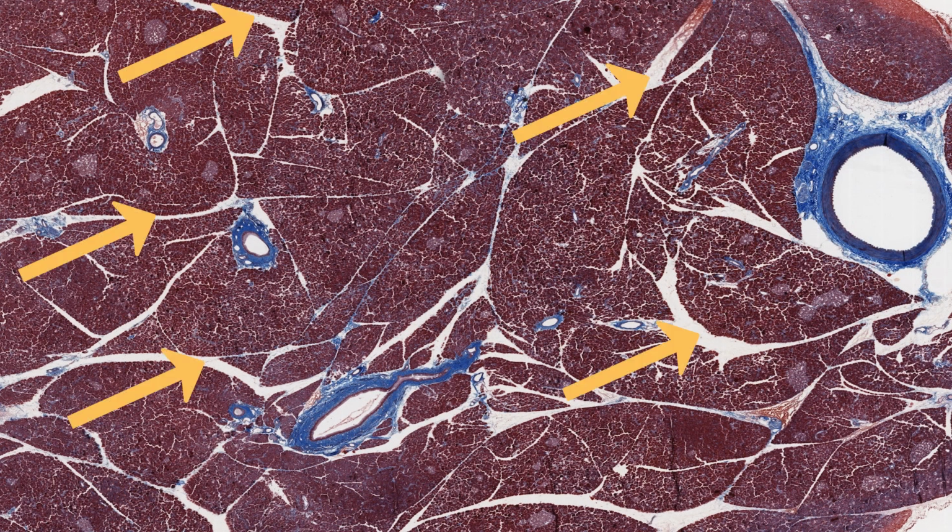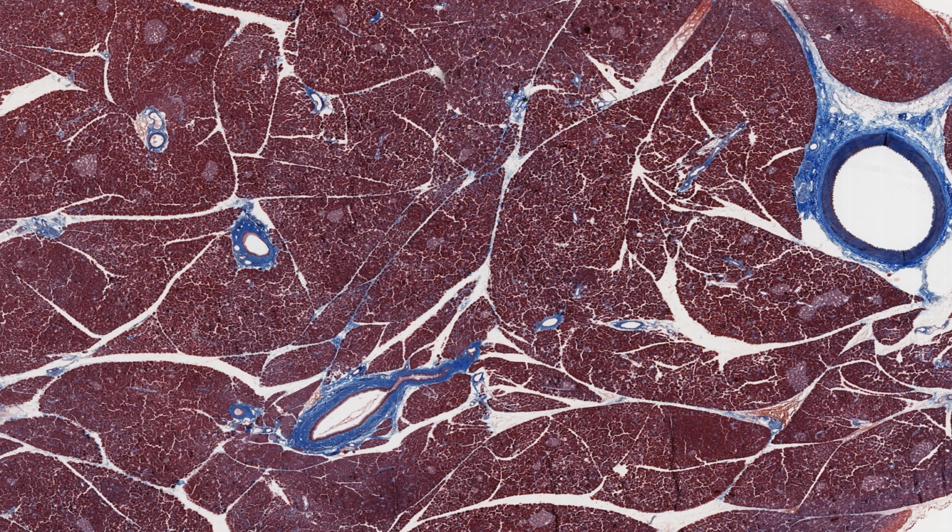The connective tissue divides the pancreas into lobules of various shapes and sizes. Tissue shrinkage has exaggerated the divisions of lobules, which is really useful to us, I think, as we can better appreciate its lobular structure more clearly. I'm going to use this section to show you some details of the duct system, but then I'll show you another section, a hematoxylin and eosin stain section, to view details of the secretory acini, as here the secretory acini are mostly stained far too intensely to see details within them.